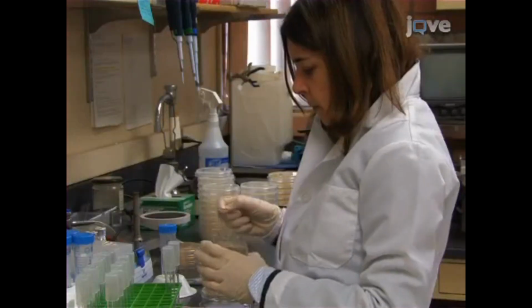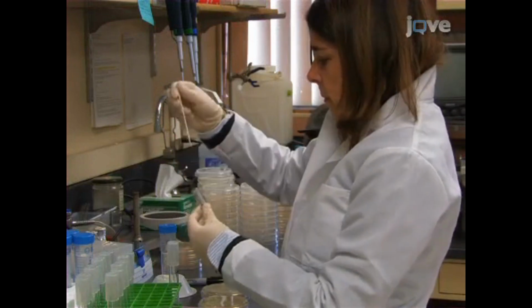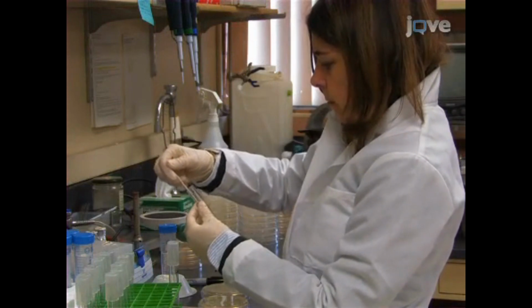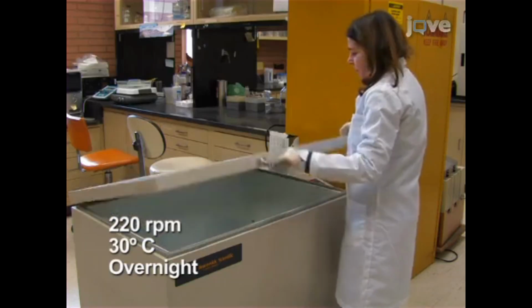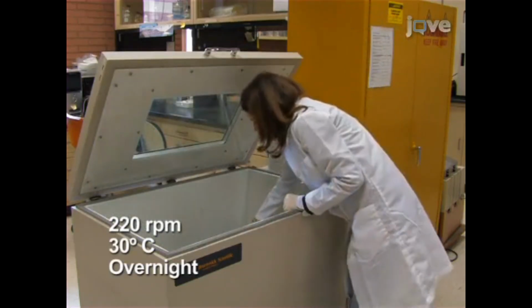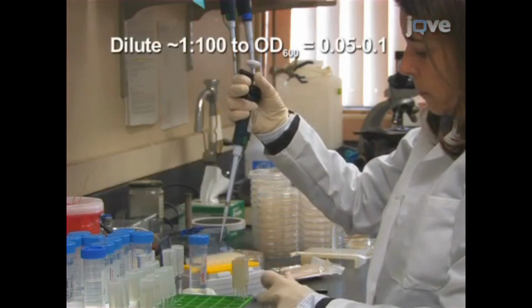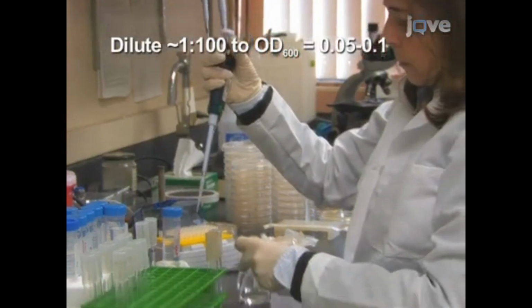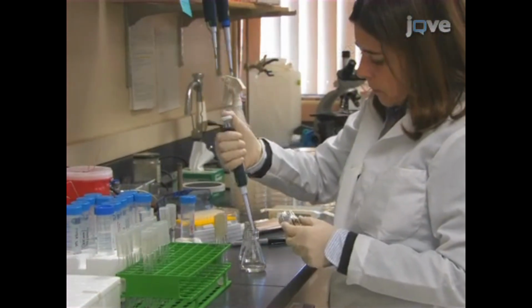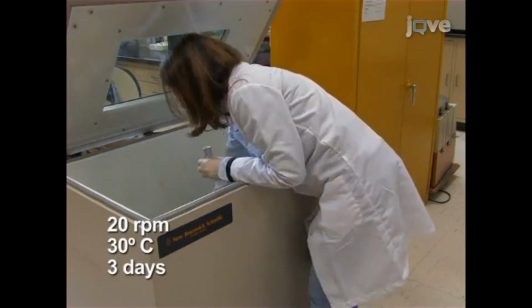To assay for yeast chronological lifespan, or CLS, first inoculate a single yeast colony into 1 milliliter of synthetic complete glucose, or SDC, medium, and incubate overnight with shaking at 30 degrees Celsius. On the following day, dilute the overnight culture into 10 milliliters of fresh SDC medium to an OD600 of 0.05 to 0.1. Incubate with shaking at 30 degrees Celsius for 3 days.